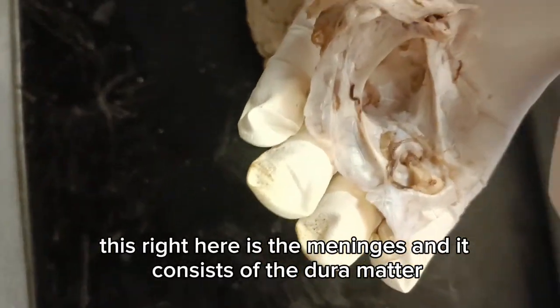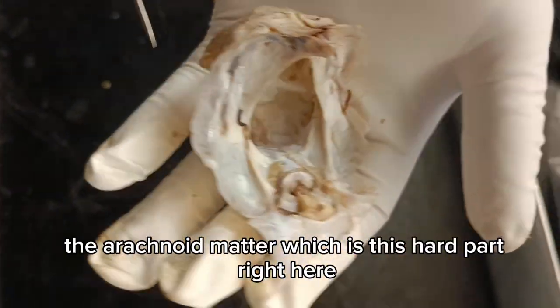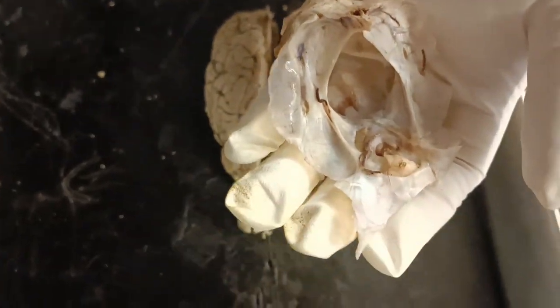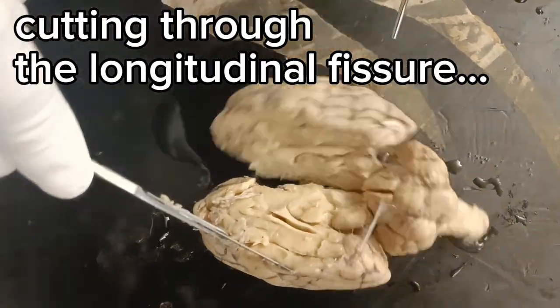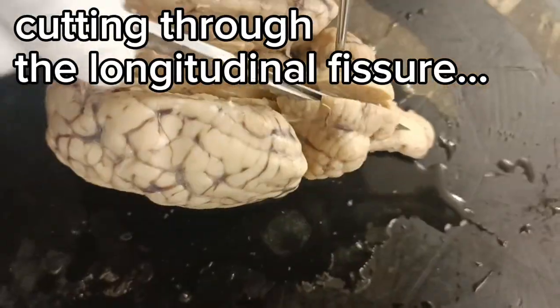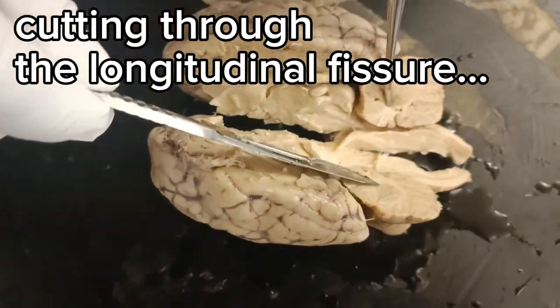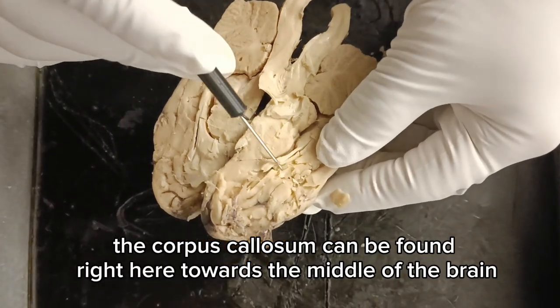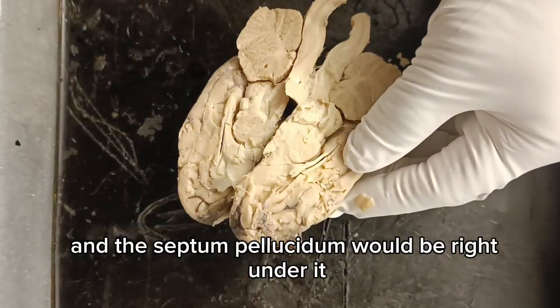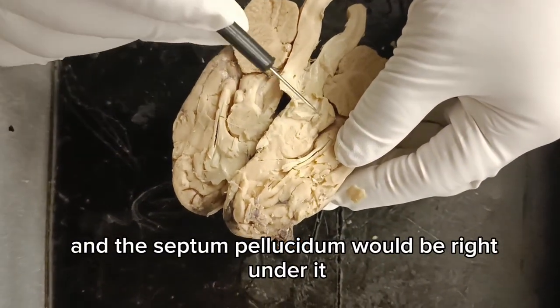This right here is the meninges, and it consists of the dura mater, which is the outside layer, the arachnoid mater, which is this hard part right here, and under it is the pia mater. Okay, the corpus callosum will be found right here towards the middle of the brain, and the septum pellucidum will be right under it, this circular part.